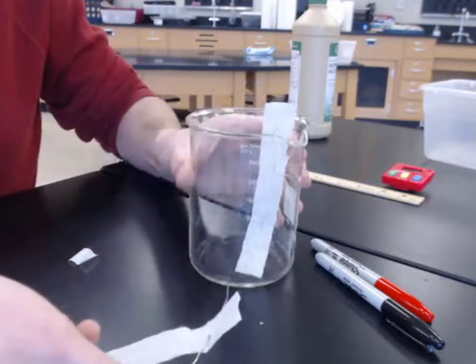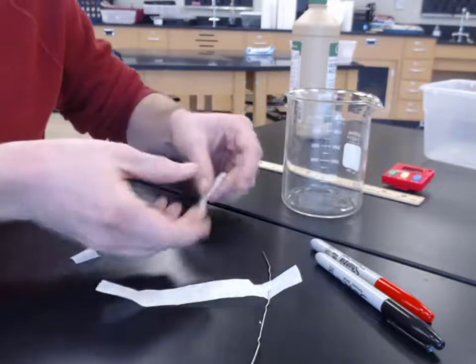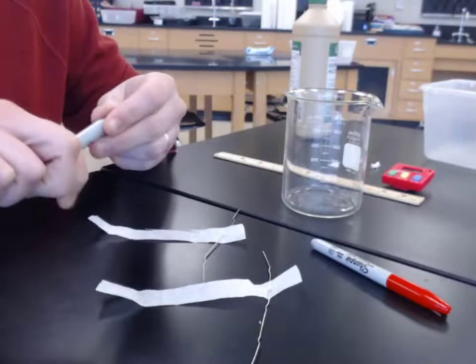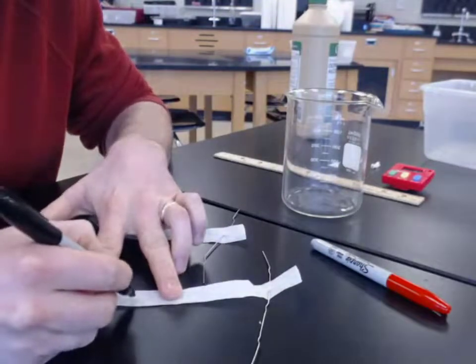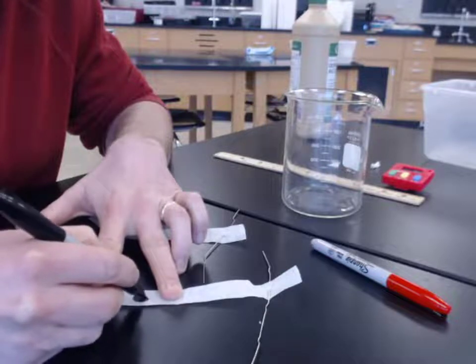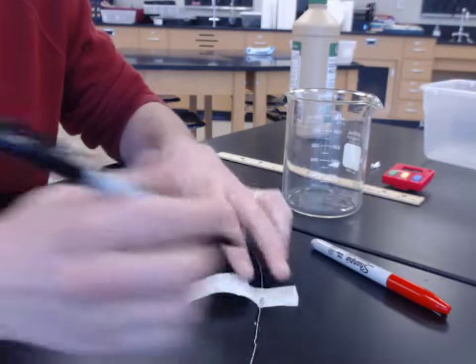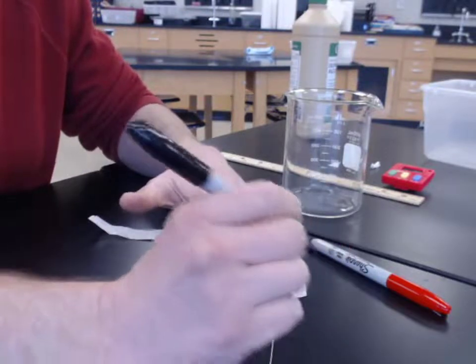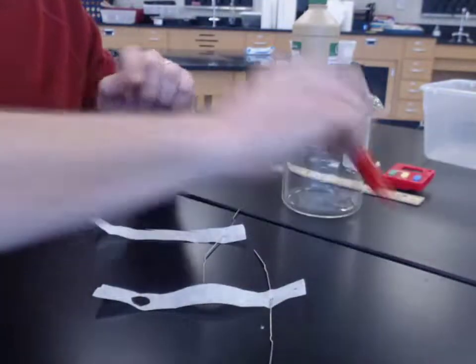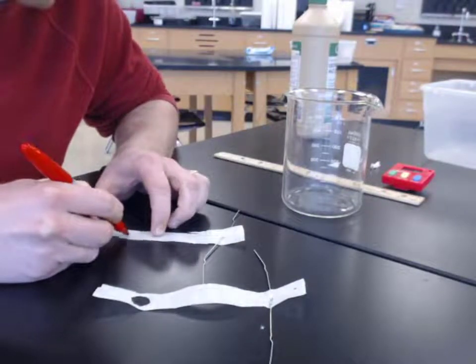Depends on how quickly this all happens. So now we just need to put our ink on each of these guys. Our inks are our mixtures. So I'll start with my black Sharpie here on this one. I don't want to put it at the very bottom because I want to give it some space so we can clearly see the capillary action starting to happen. And I'm putting a dot at the top to make sure I know which one is which, because who knows what these colors at the bottom could change to once we get that solvent moving through it.